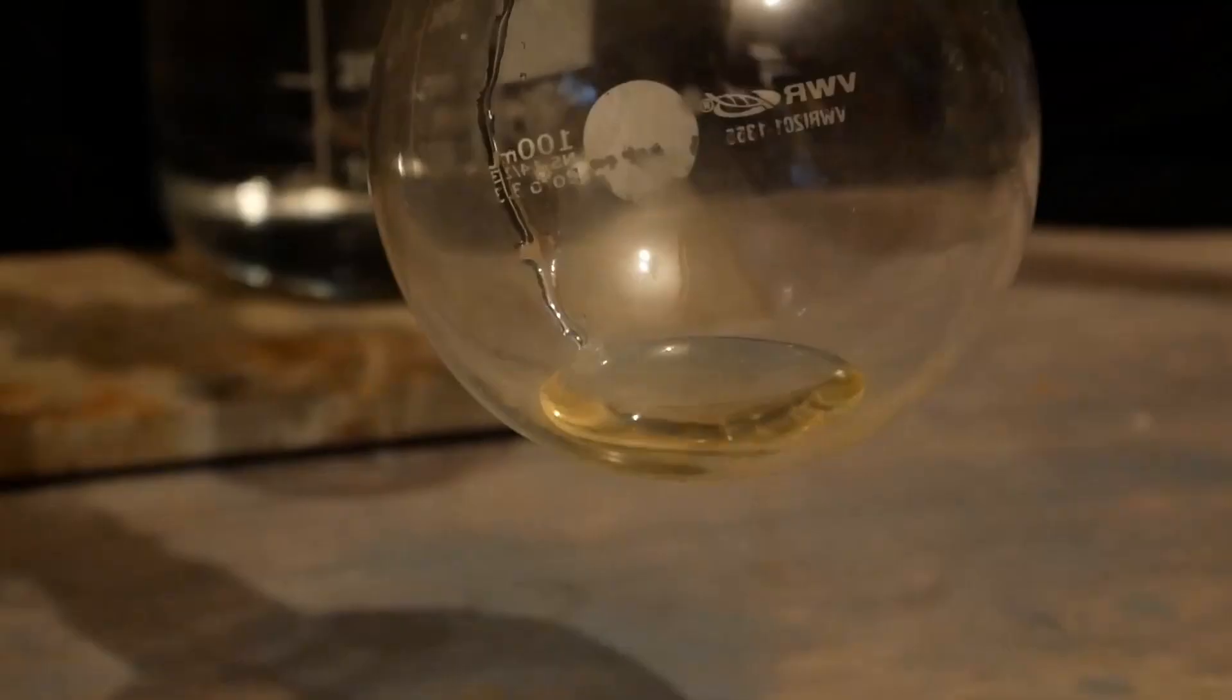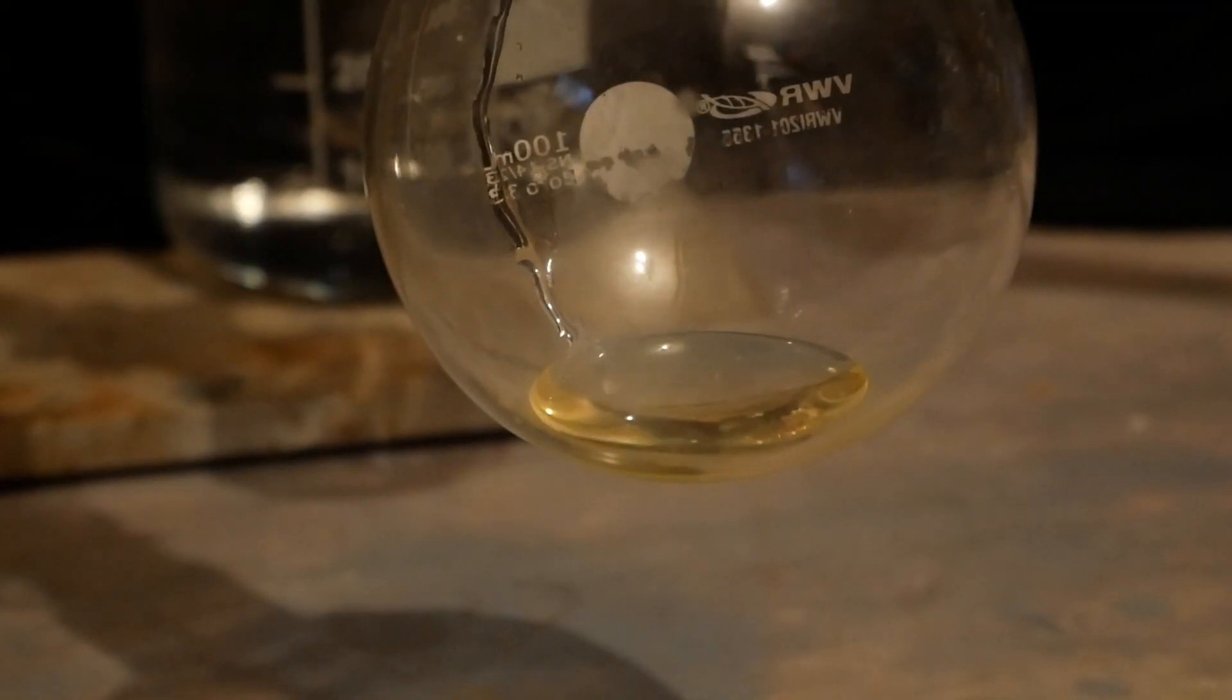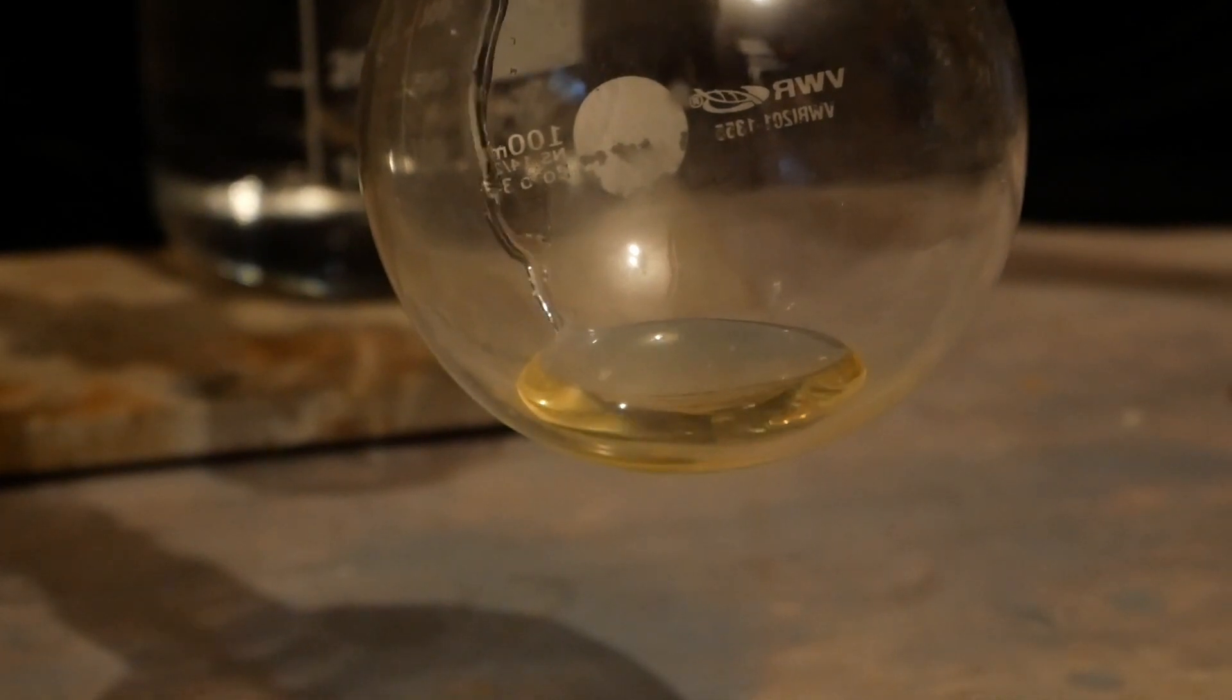The aniline is once again strongly colored yellow, but let's hope that our yield has improved.